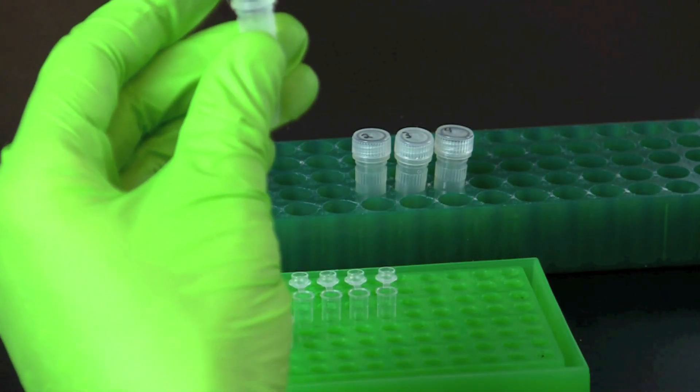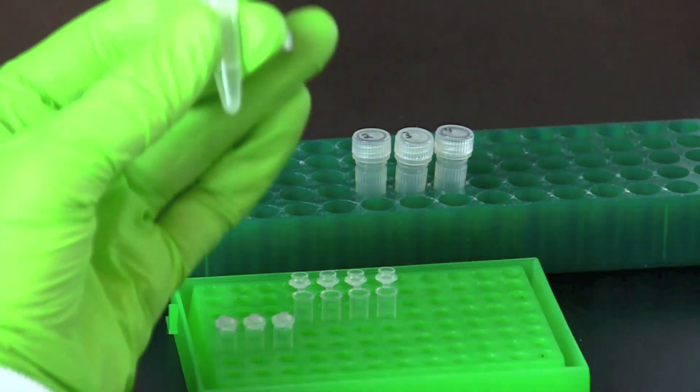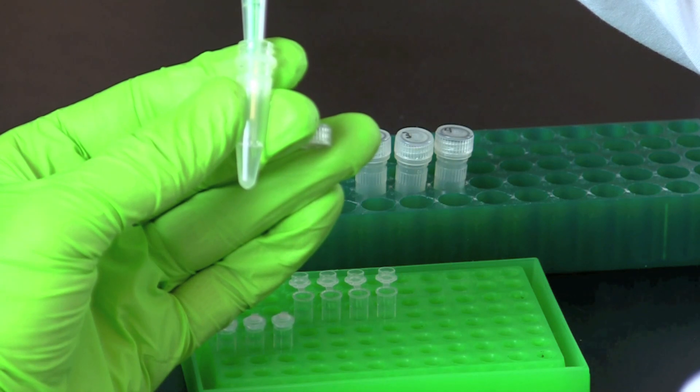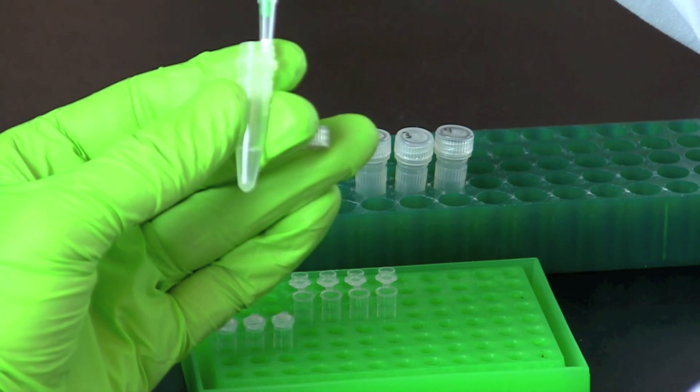Pipet 20 microliters of DNA template into the correspondingly labeled PCR tube. Avoid disturbing or transferring the pellet of instagene matrix which is at the bottom of the student samples.